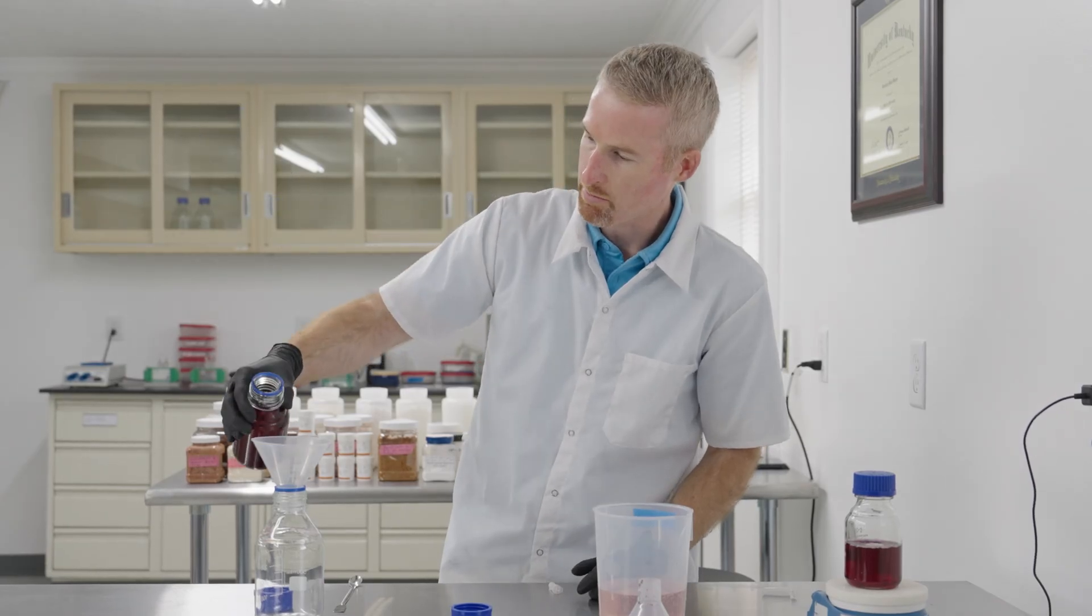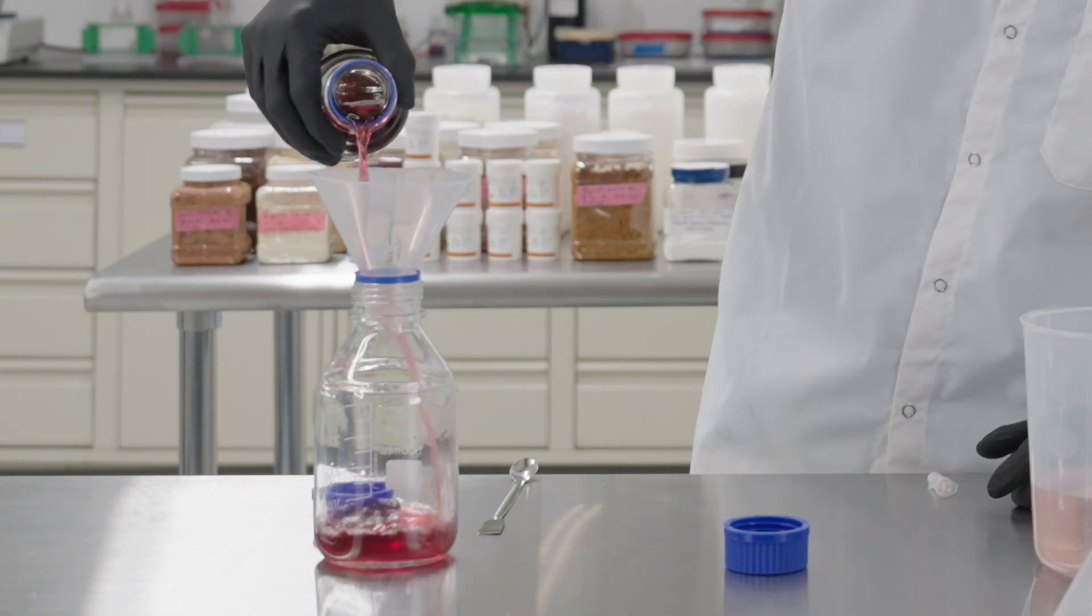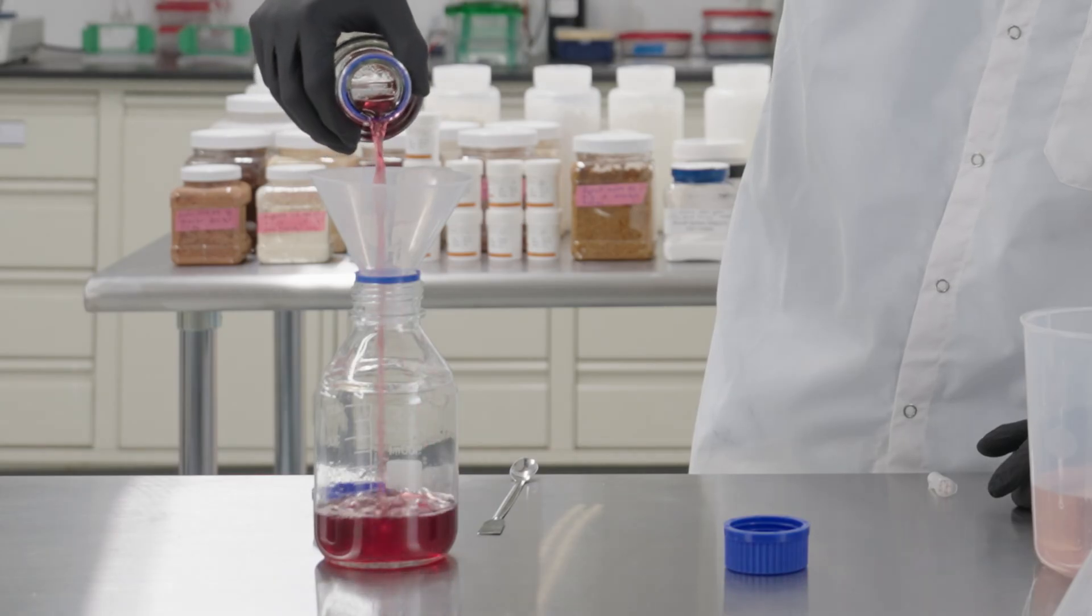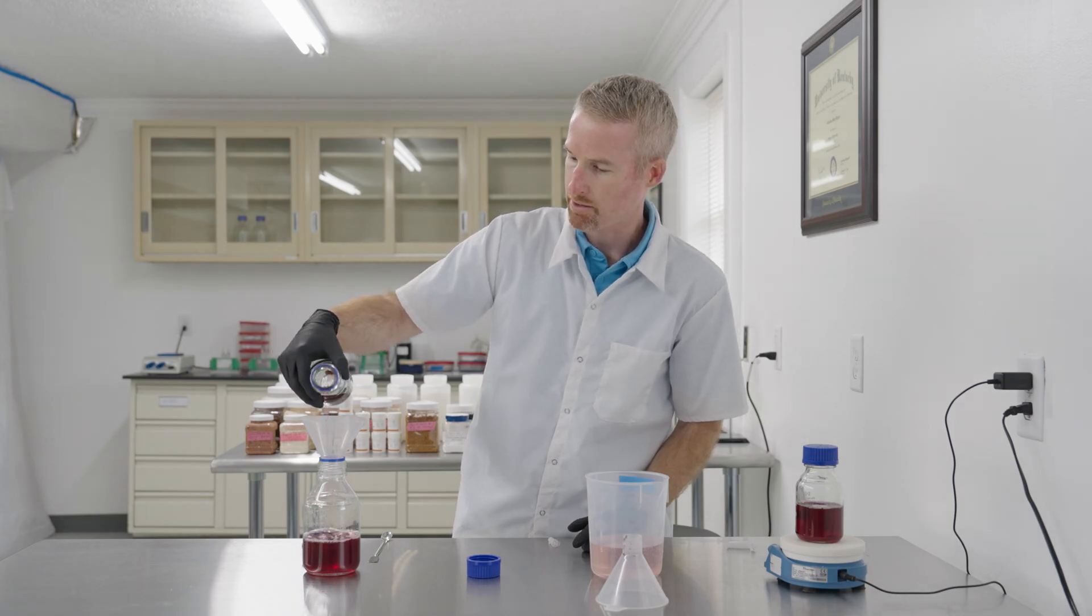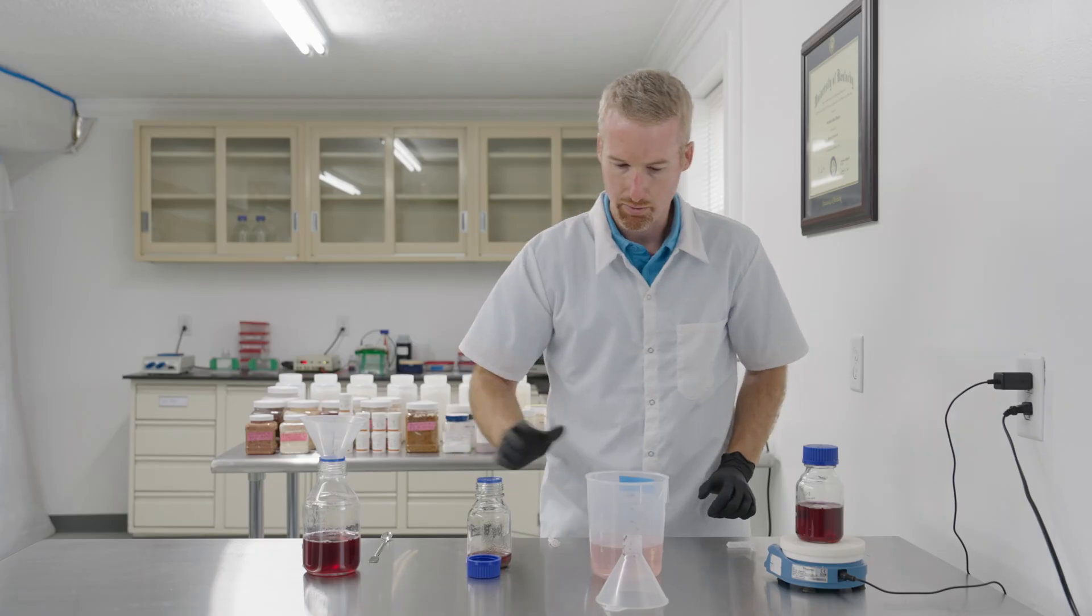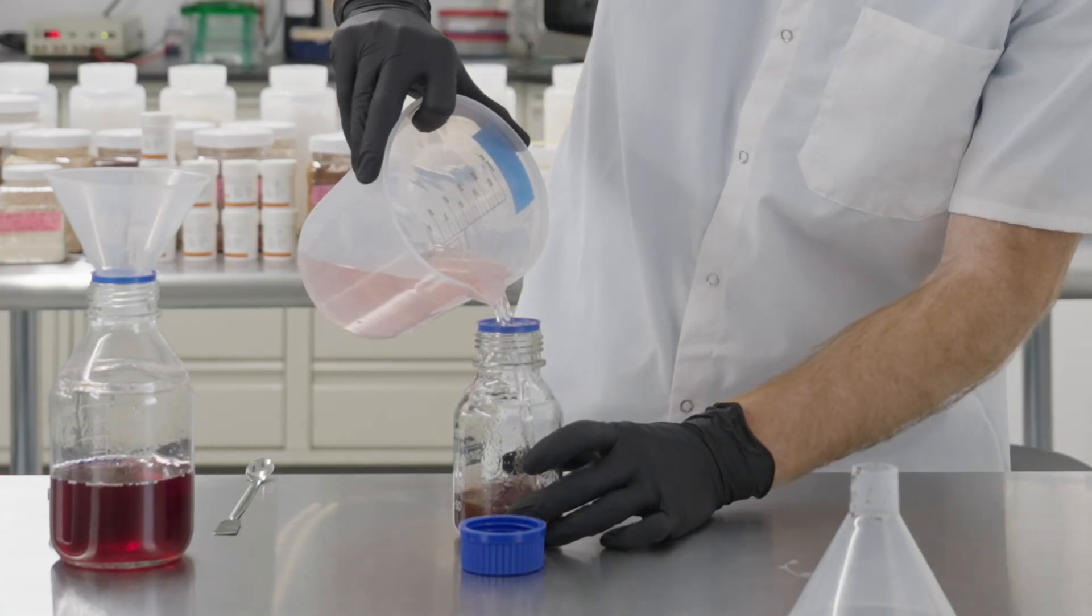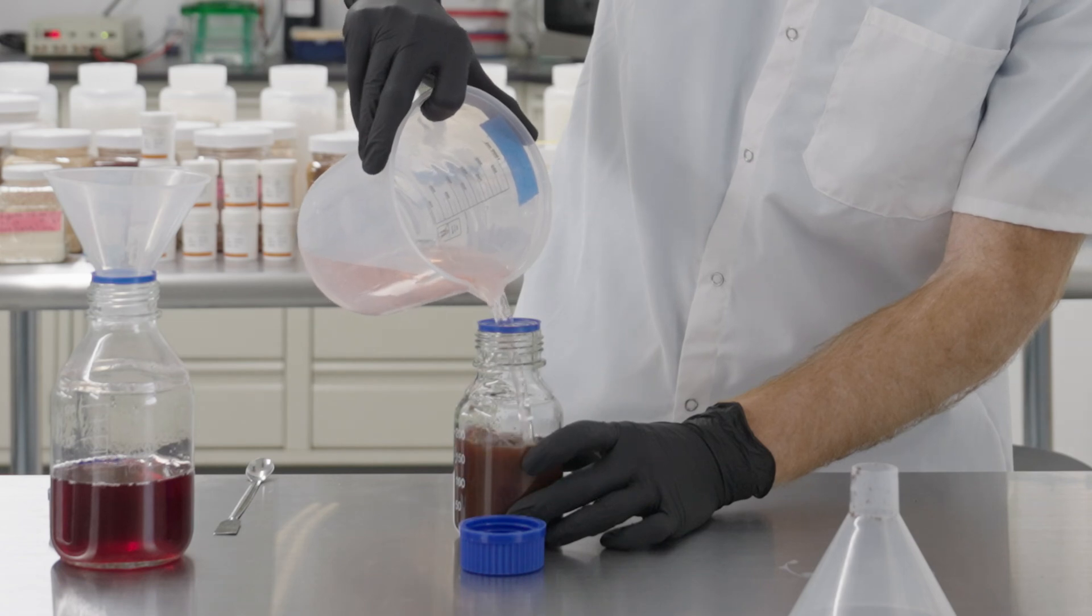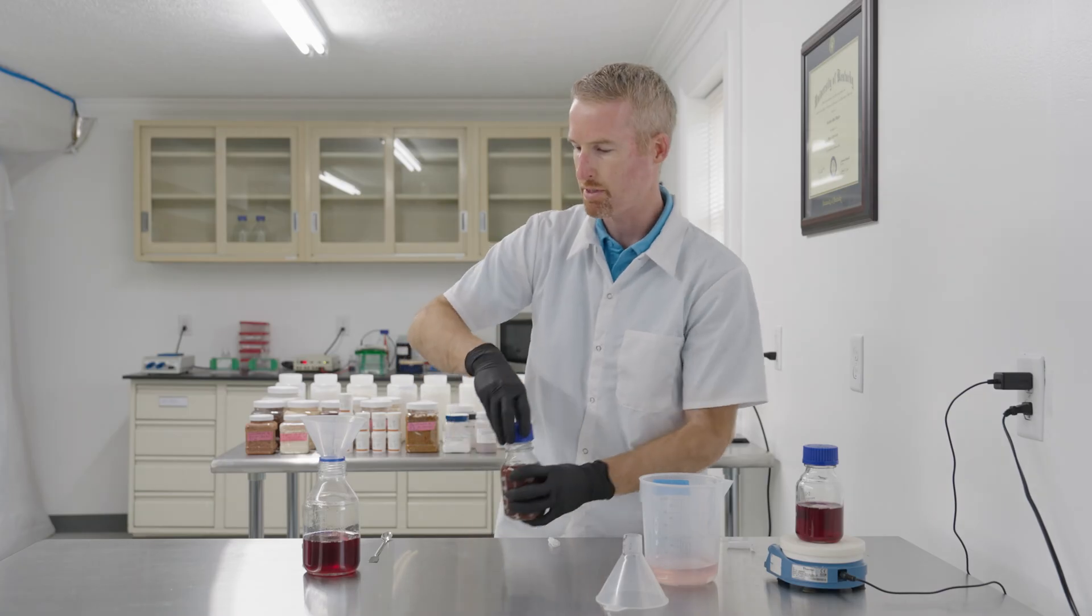This has settled now, so I'm going to pour off the glucose product. This would be similar to making lactose-free milk because the lactose is all broken down. We're ready to do round two using the same enzymes over again.